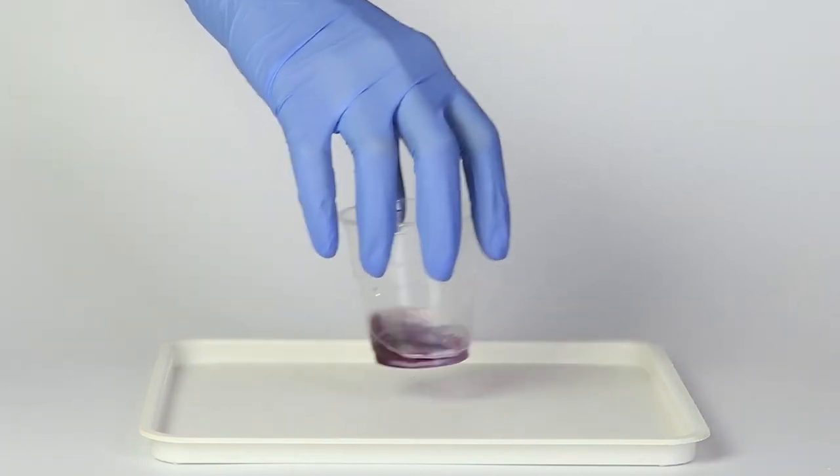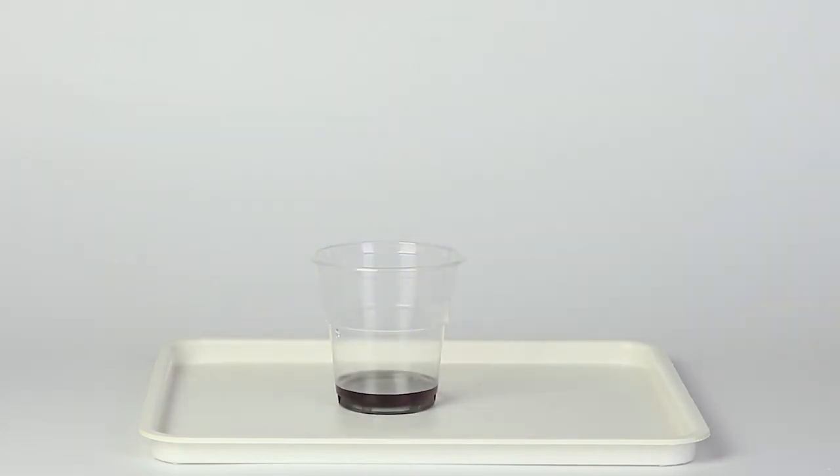Sodium hydrogen sulfate makes the solution acidic, and in acidic conditions, anthocyanins turn red. Sodium carbonate solution has a basic medium, so it gradually makes the solution more basic. All of these make the anthocyanins solution change colors from red to blue and green, indicating the changes in pH.